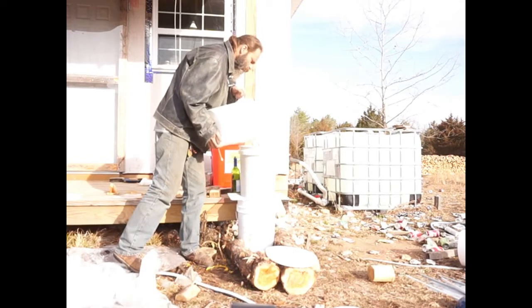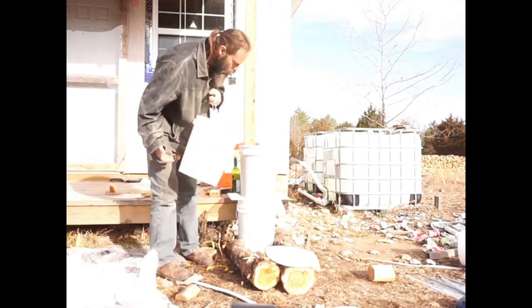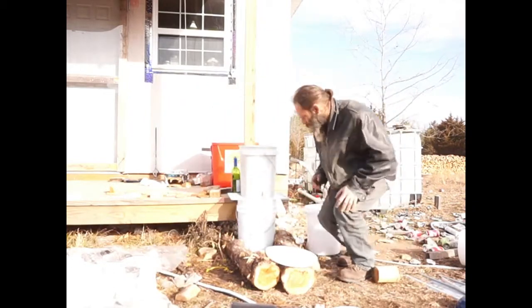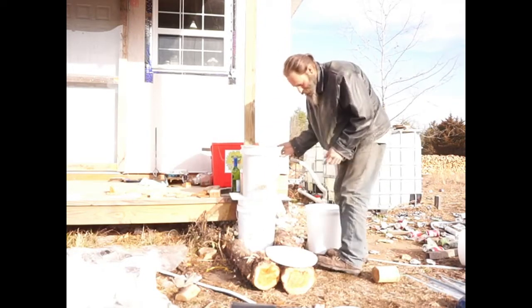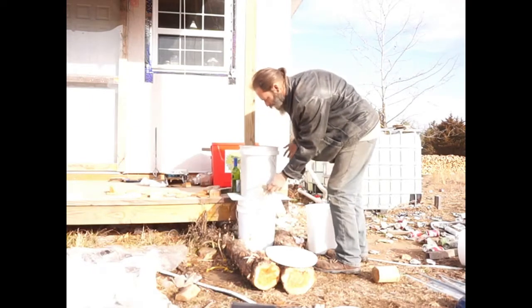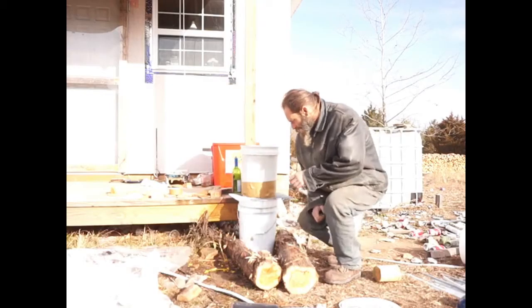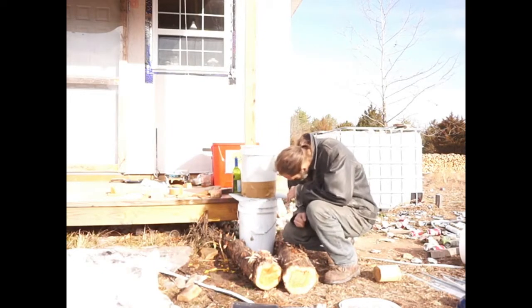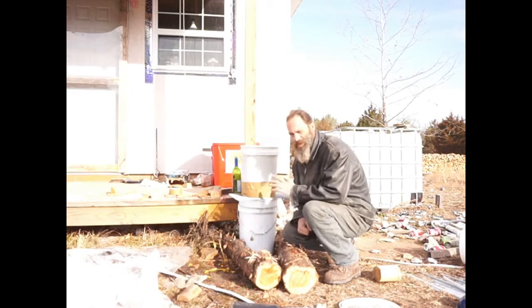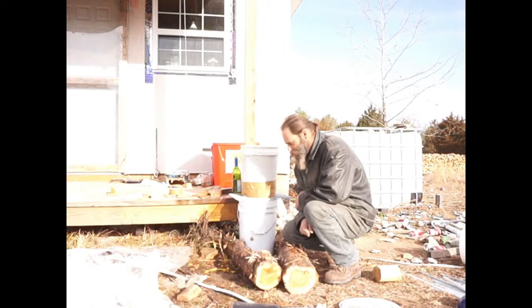Most of the water takes a while — there it goes gushing out of the side. A little too much gushing — it's not going where I had planned, so we're going to have to do something different here. Packing tape — probably not the best solution in the world, but it seems to be working. Now we're getting little drips out instead of big gushing flows. I've probably lost a good chunk of ash and I'll have to factor that into my final yield.